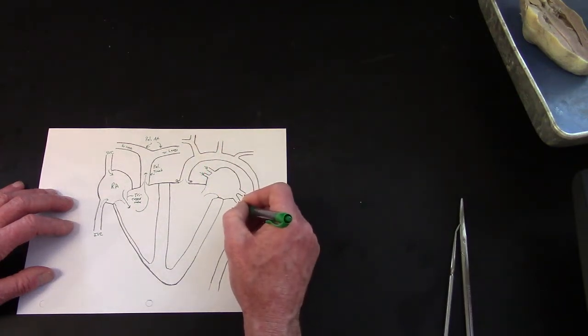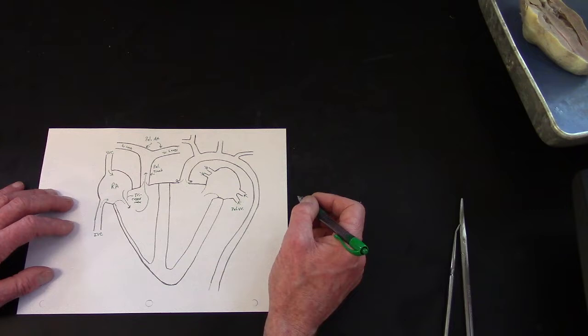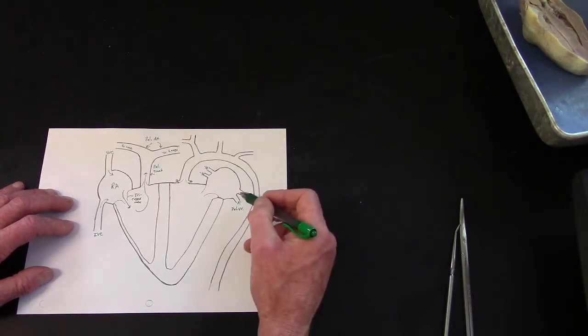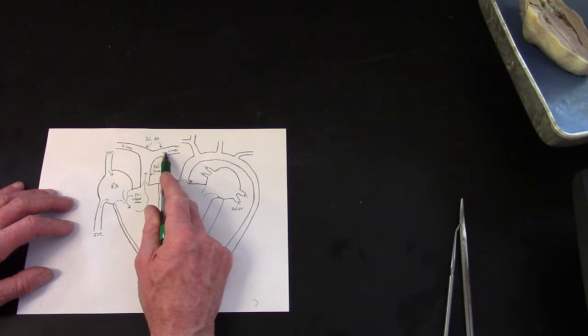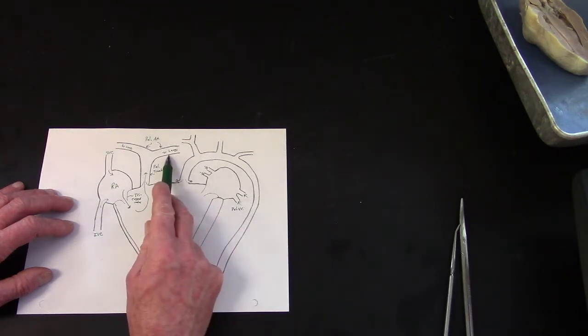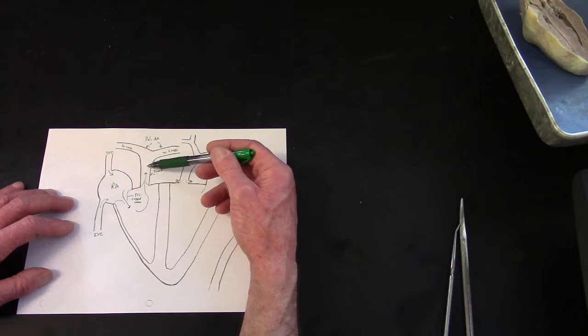So those are the pulmonary veins, VV, abbreviation for plural of veins. And on the models, these would be colored red for the oxygen, but they are the veins, and these are colored blue, but they are the arteries. So don't think that arteries are always red, because in the pulmonary circuit, pulmonary arteries are shown to be blue because they're low oxygen. But again, they're still arteries because the blood is leaving the heart.